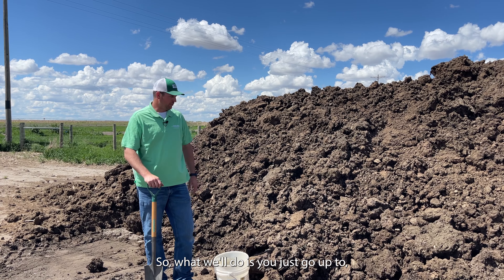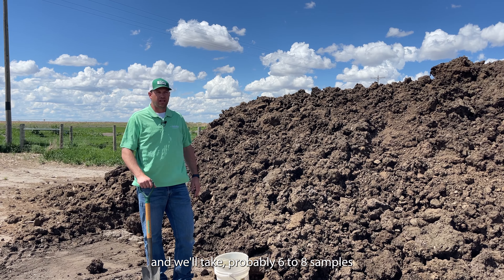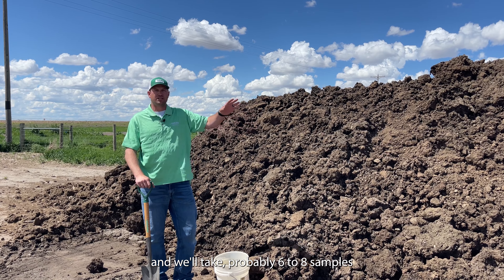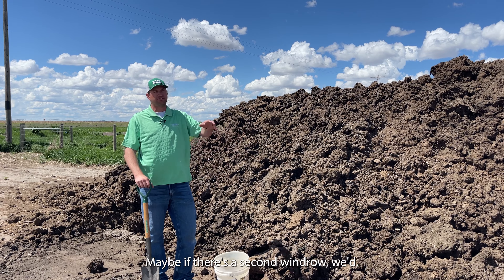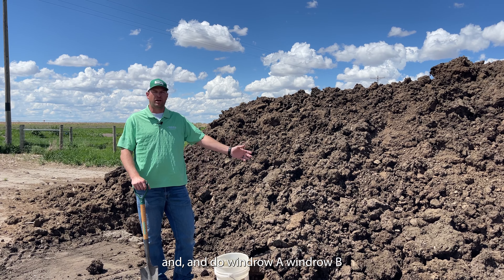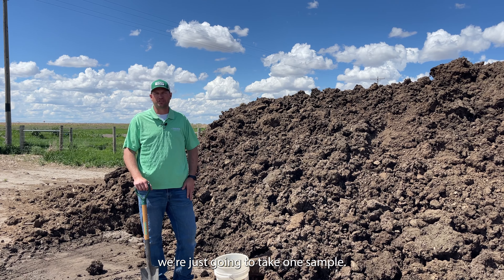What we'll do is go up to where your pile is and take probably six to eight samples along the length. If there's a second windrow, we'd split them and do windrow A and windrow B. But for today's example, we're just going to take one sample.